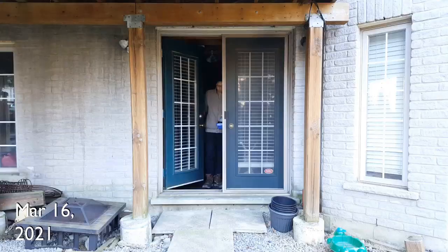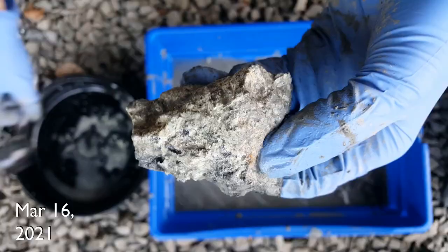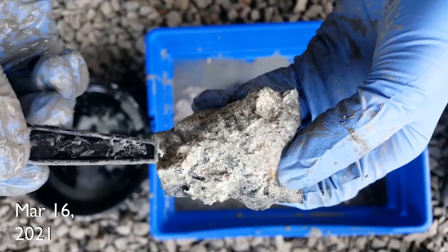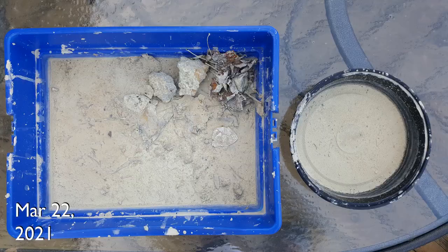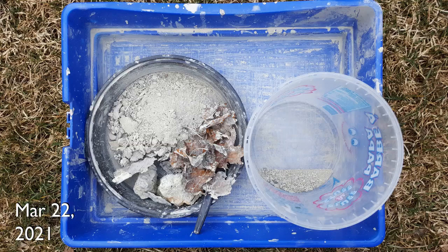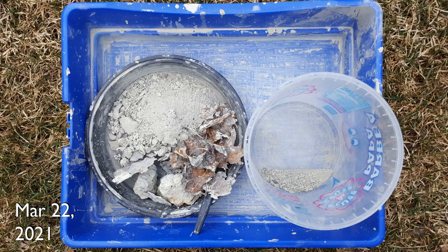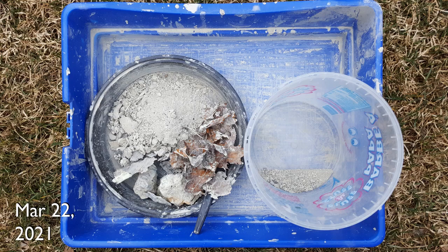I got home and proceeded to sort through what I had brought back — mainly organic matter and some rocks which were covered in a white deposit, which I presumed was sulfur or a sulfur salt. After letting it all dry, I was left with what appeared to be some dark dirt and some light dirt. It actually looked a lot dirtier than I thought it would, and contamination is an issue, since I still needed to do tests to figure out whether I had elemental sulfur or a sulfur salt. This dirt could contain a lot of other stuff, and without knowing what I was dealing with, the conclusions I draw from my tests wouldn't be very convincing.